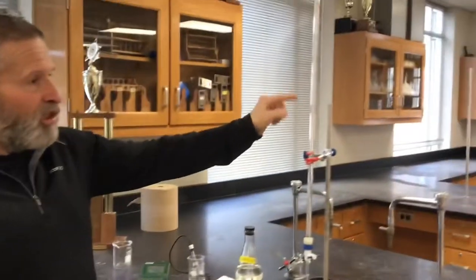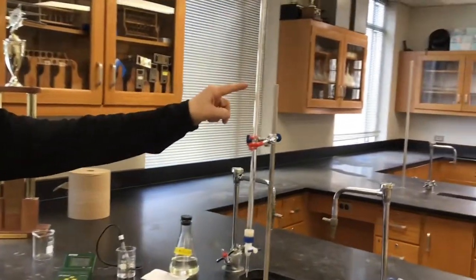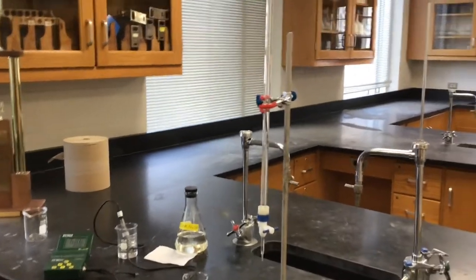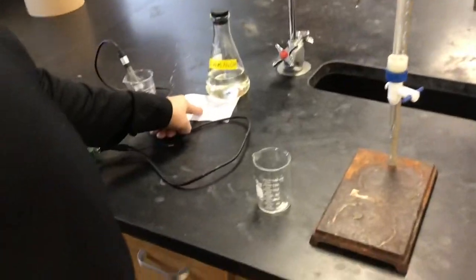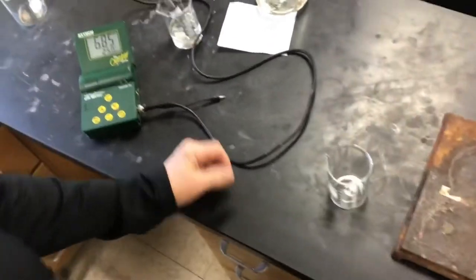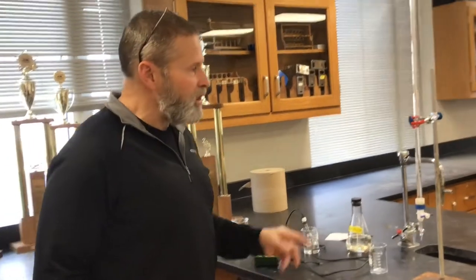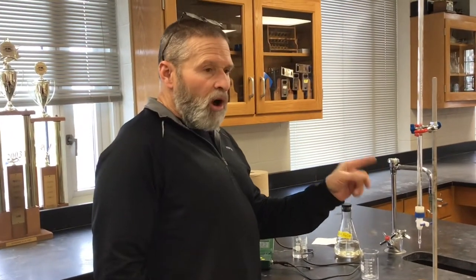What we've got today is a strong base — sodium hydroxide — that is in our burette. The concentration of the NaOH is 0.187. We standardized it yesterday. So for part one of this lab, we're titrating a strong acid with this standardized NaOH.